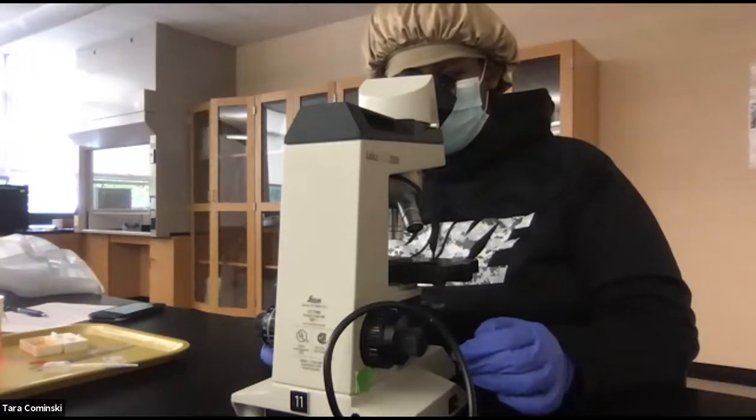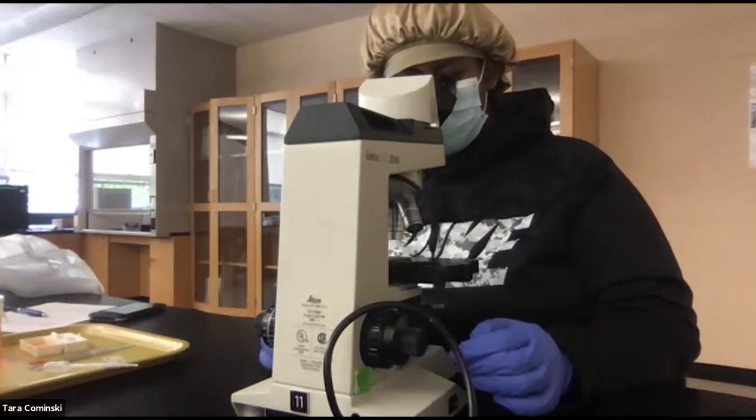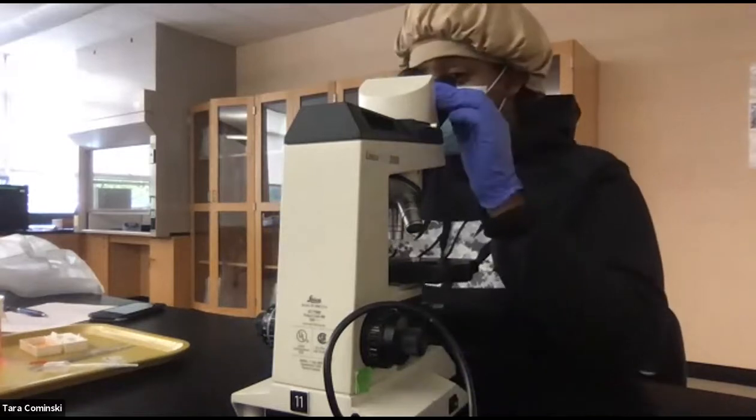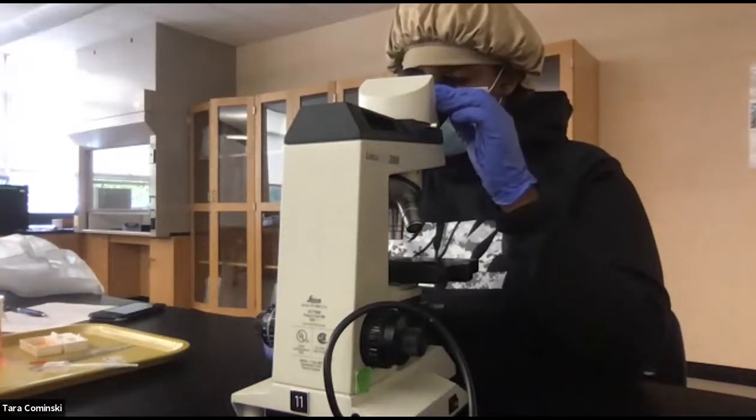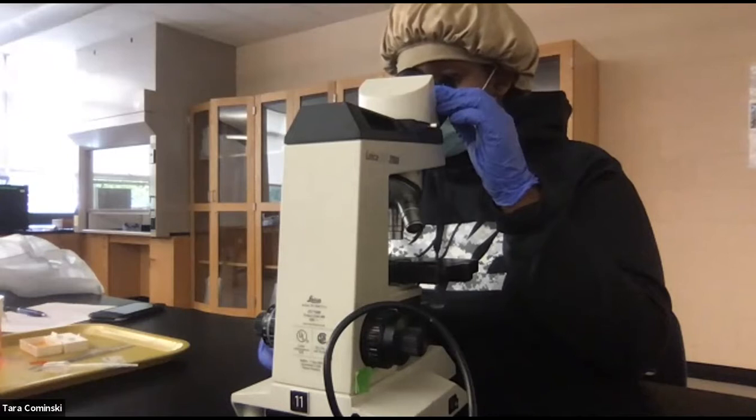All right, good. You're good. Slide it all the way back there like that. Now, this will turn it on. This is your light intensity here. Once you get it on, you're going to use this to move it so that you get your E right in the middle there. And then also flip it so your scanning objective is in there. Did you get it in focus? I'm going to put one on my microscope.